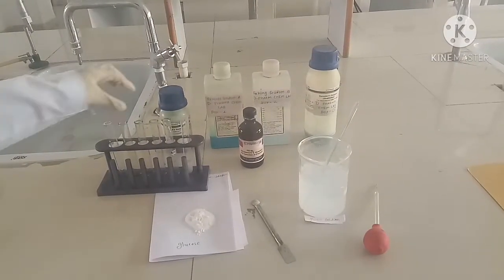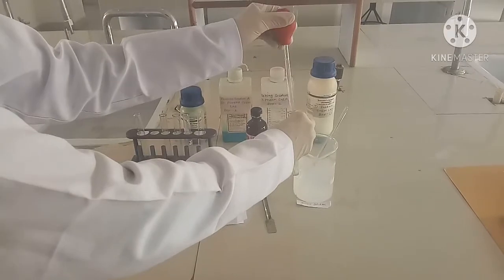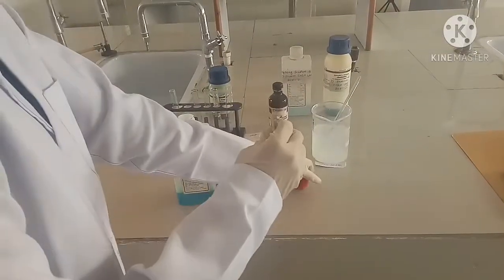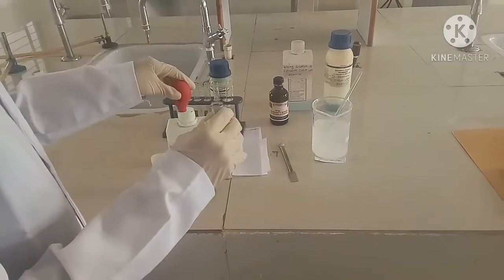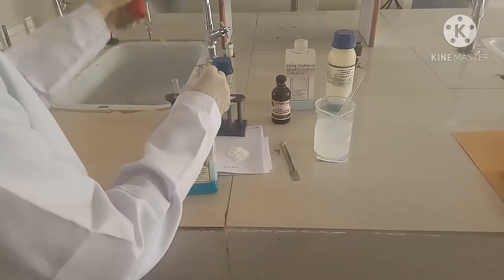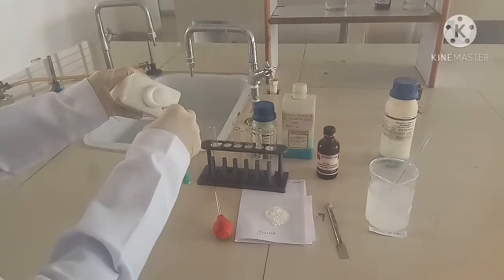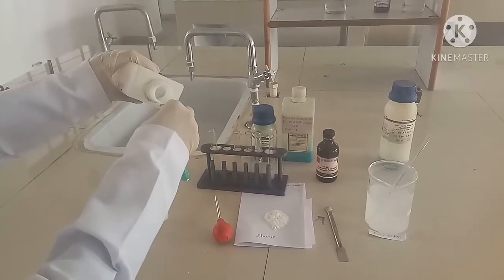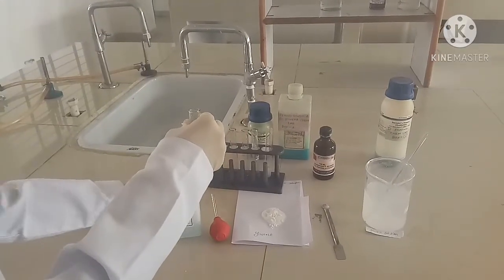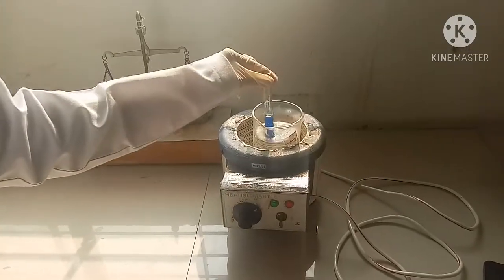For the Fehling test of carbohydrate, take 1 ml of glucose solution and add 1 ml of Fehling A solution, then add Fehling B solution. Keep the test tube in a boiling water bath.